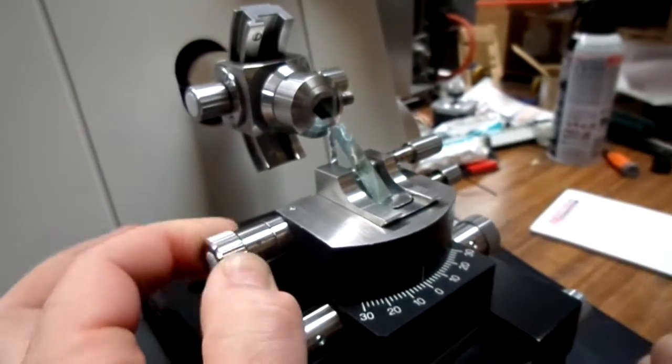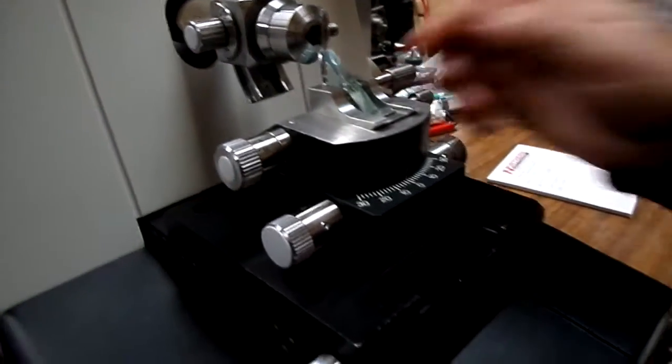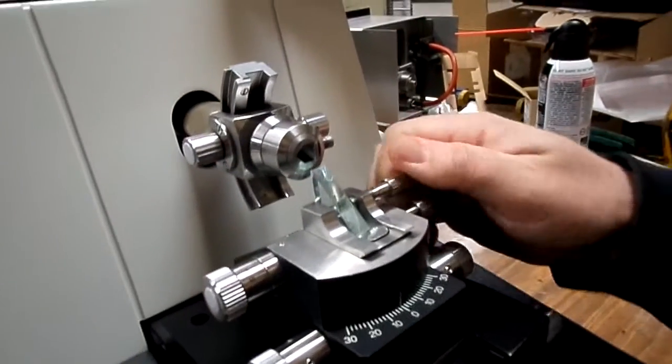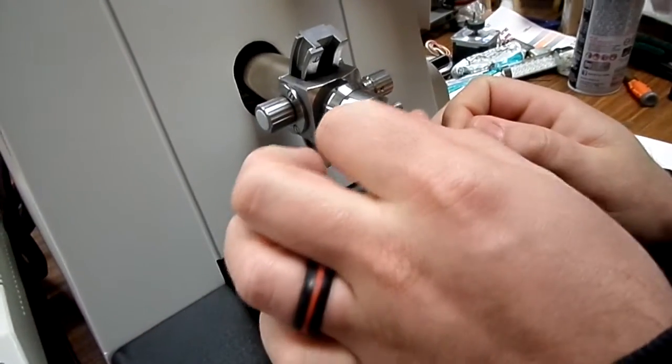If this is tightened, you can still turn this, but as you can see, it will not move. And then your blade obviously comes out with that knob there.